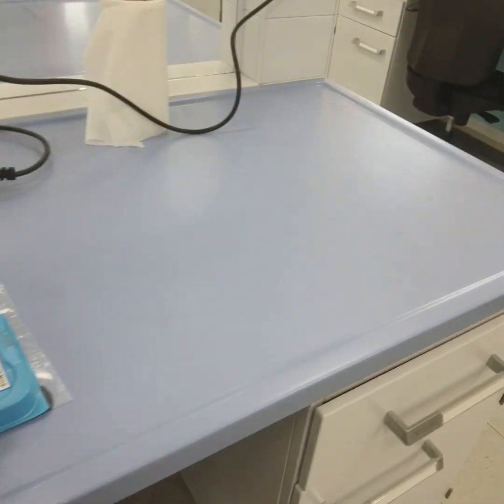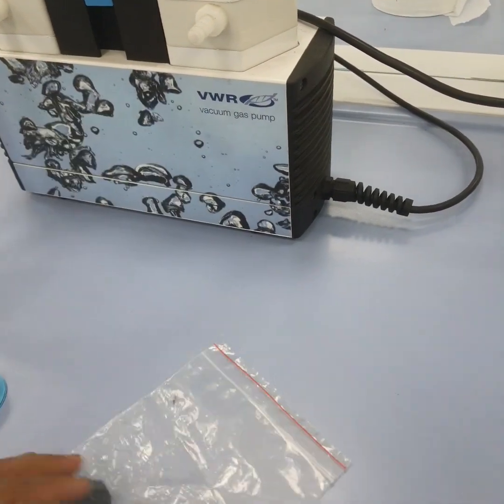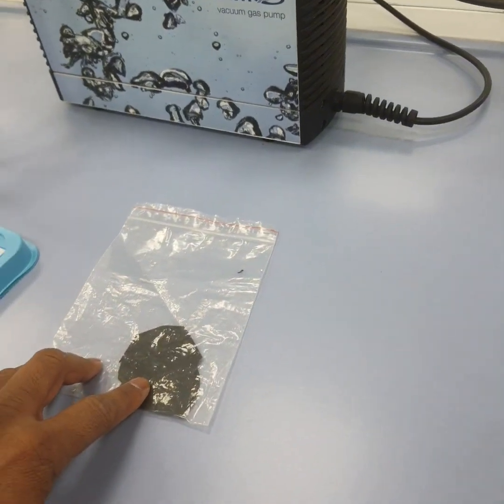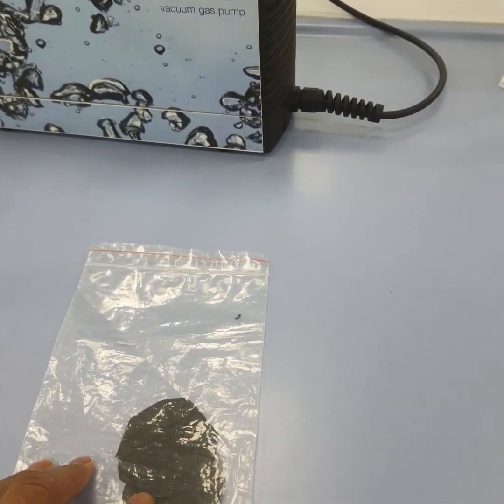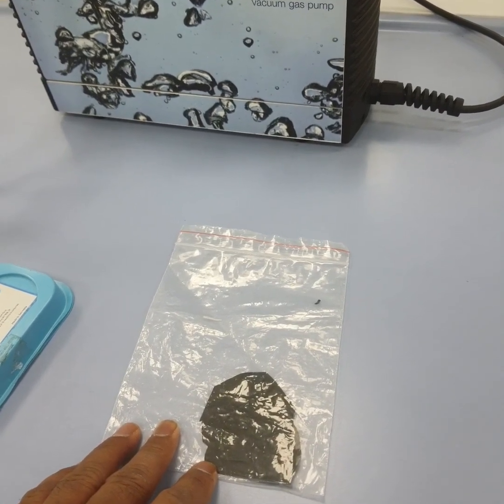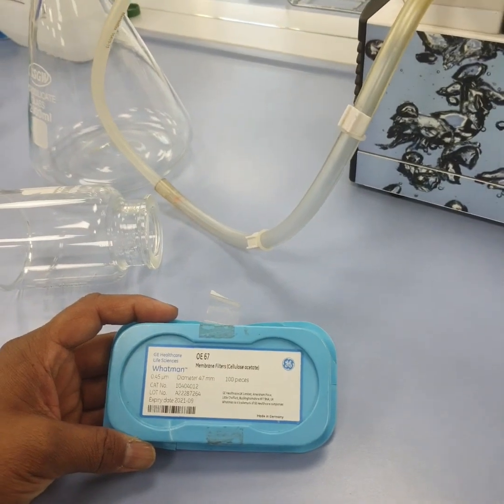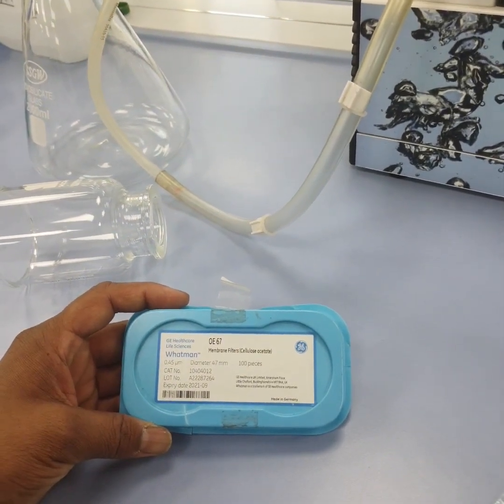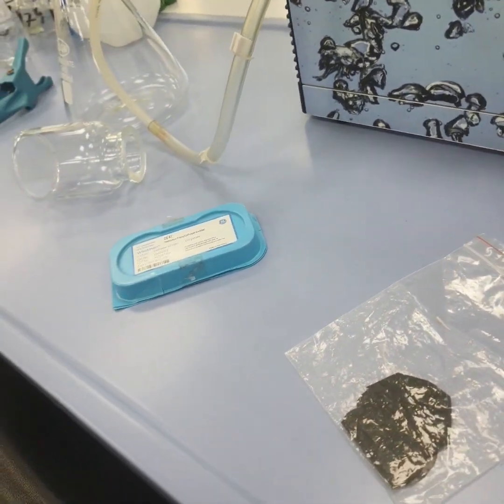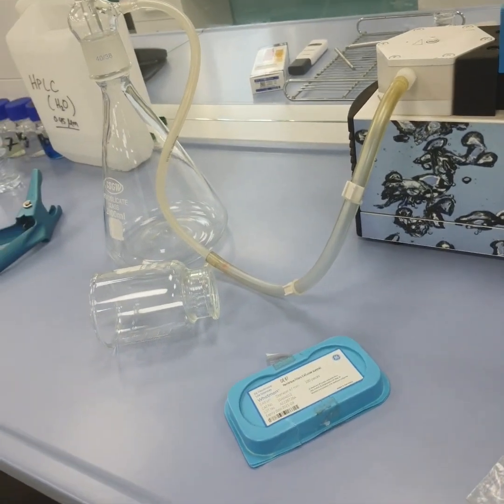The first membrane is my PVDF based membrane, where PVDF is the support membrane for this CNT based PVDF membrane, and this one is the commercial membrane called cellulose acetate membrane filter. We will check the efficiency of both membranes for the separation of the pollutant, which is methylene blue.